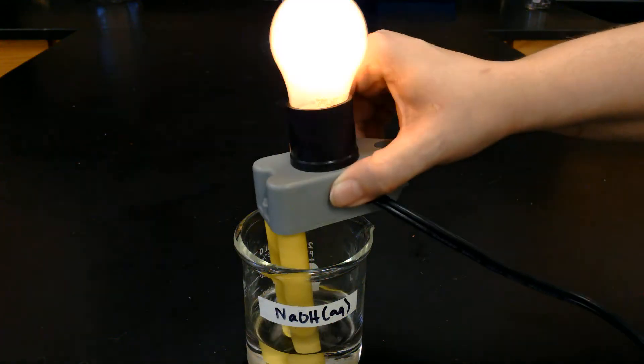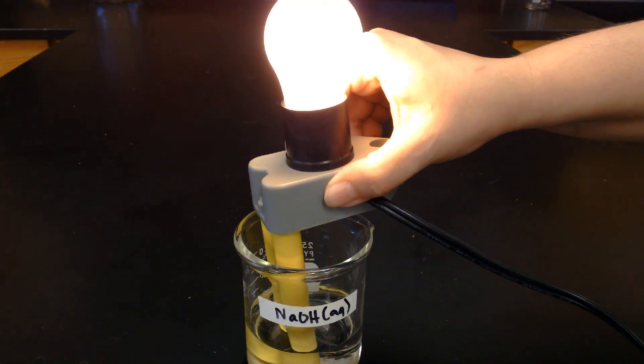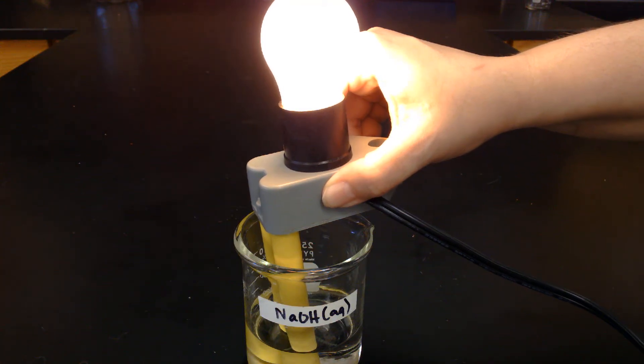Next we're going to try some aqueous sodium hydroxide. Nice and bright. Go ahead and make your observations.